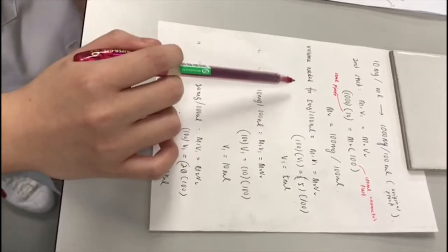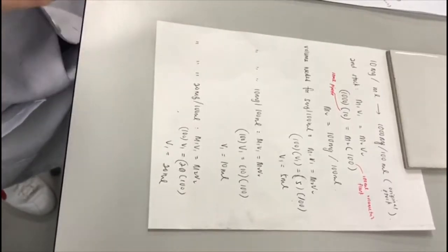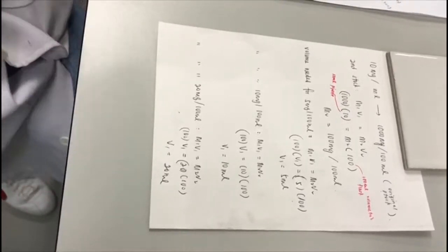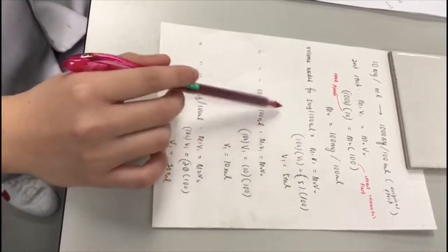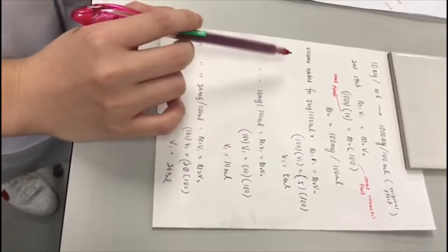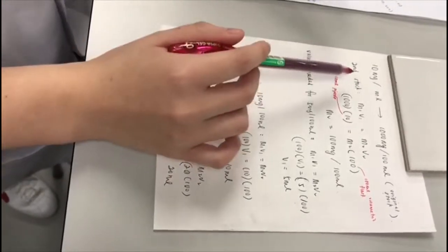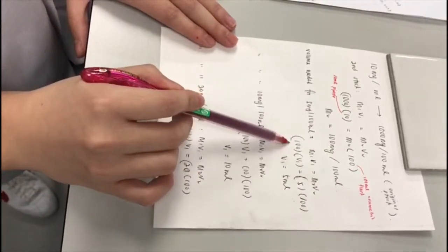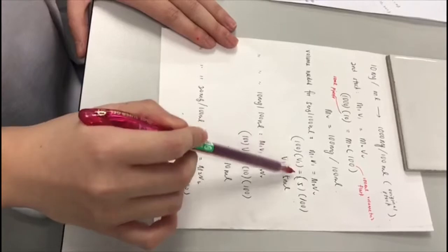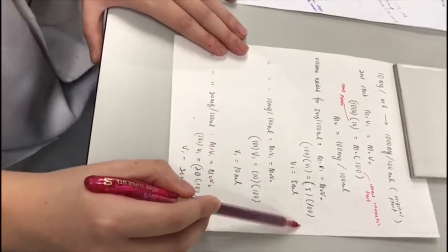Now we are going to find the volume needed for the standard solutions of different concentrations, which are 5, 10 and 20 mg per 100 ml. We also use the same formula, M1V1 equals M2V2, to find the volume. As with the second stock, we use the second stock concentration, which is 100, and then find the volume for a concentration of 5 in a 100 ml volumetric flask.